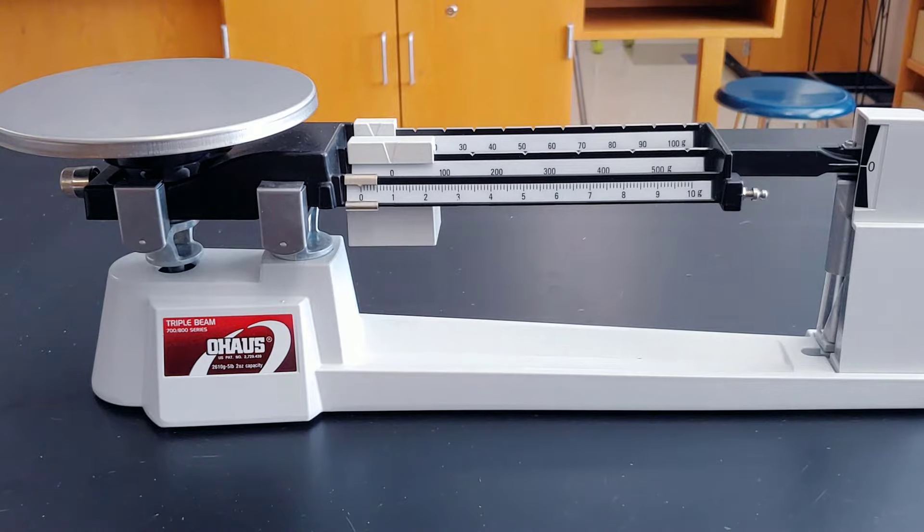Hi, this is Mr. Biter. In this video, I'm going to show you how to use the triple beam balance.